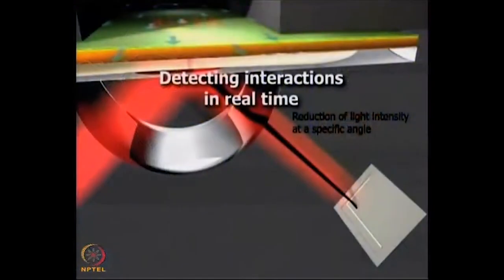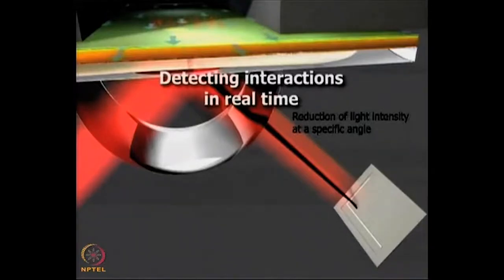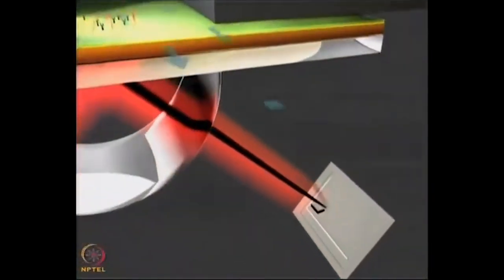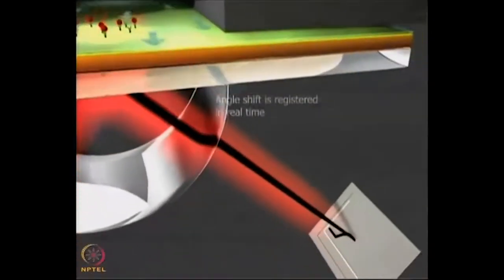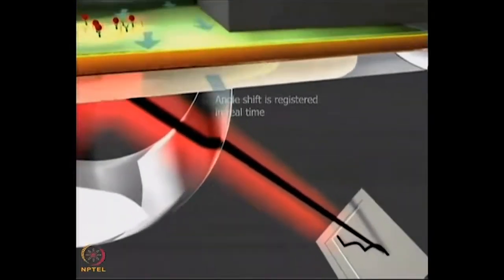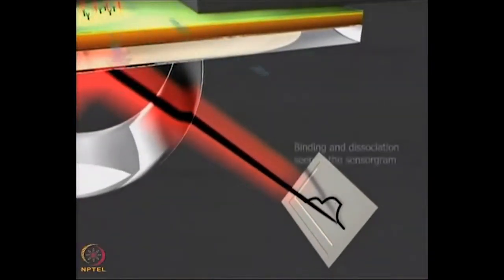When I go to video 2 now, you will see how biological interactions are studied. Let us assume that you have an interaction A plus B gives AB. What you do in SPR is you take one of the interactants, say B, and put it on the chip and pass A over it. You take B and immobilize it on the chip — you can see the molecules getting immobilized right now. When the molecules get immobilized, there is an increase in mass which changes the refractive index, and that is measured in real time. You pass the second interactant A over it; if binding happens and AB gets formed, you see a further increase in mass measured in real time. You stop the flow of A and start flowing a buffer, and it comes off in a dissociation that is also seen in real time.